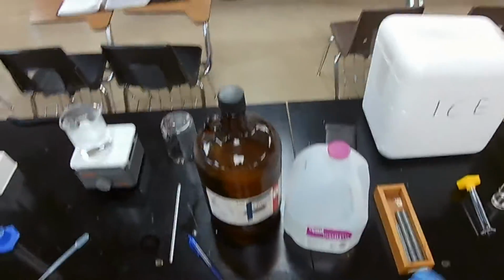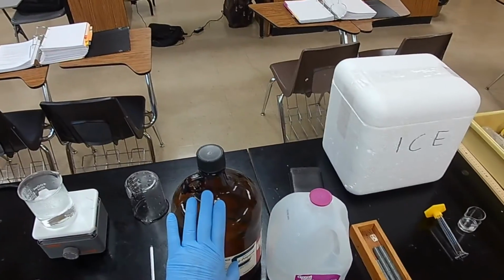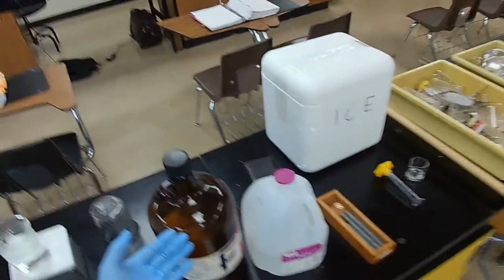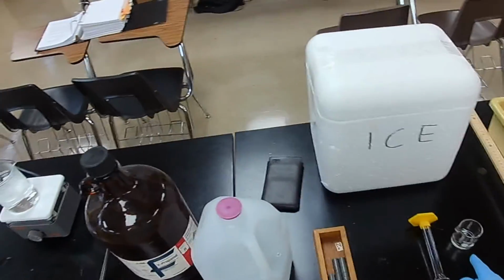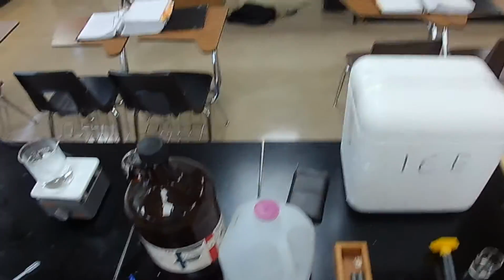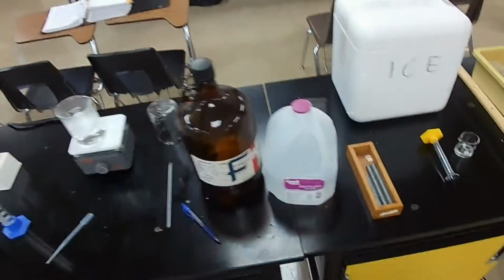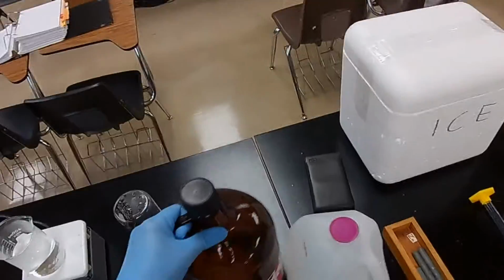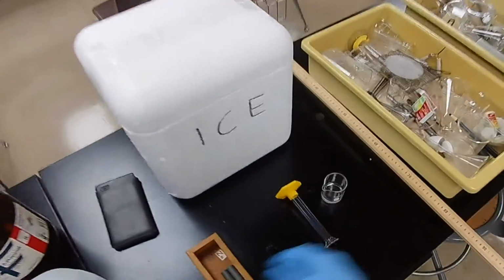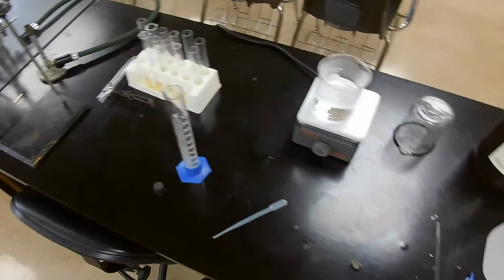But you never put anything that you draw out of a reagent bottle back in the reagent bottle. For one thing, it could contaminate your reagent. For the other thing, you may not know what exactly is in that material that you took out. You might put something back in there that's incompatible with it, and you have a reaction. So never put anything back in the bottle once you take it out. All right, so we're done with the isopropanol. Set it aside over here, deal with it for disposal later.